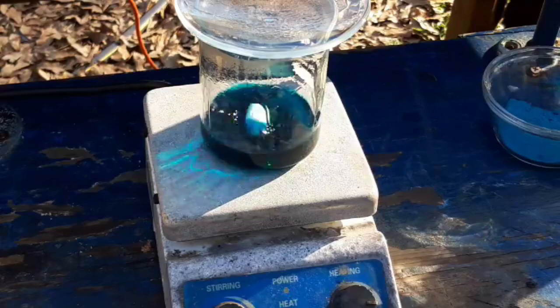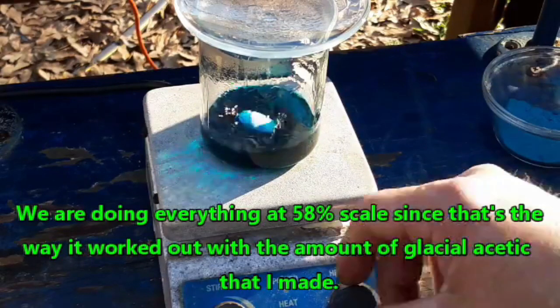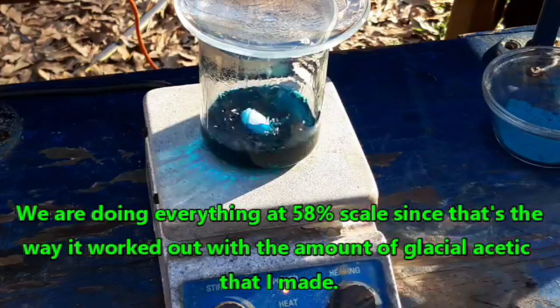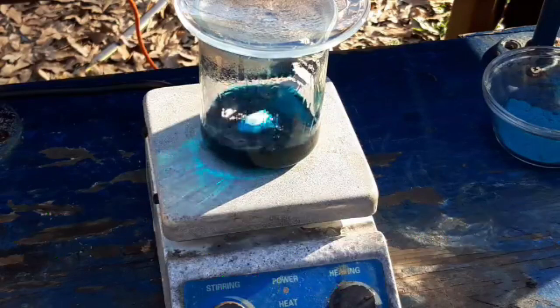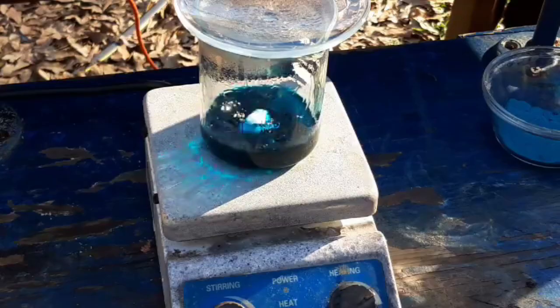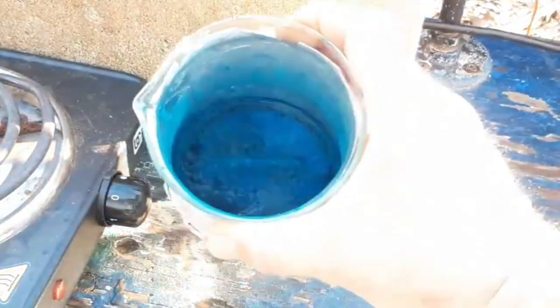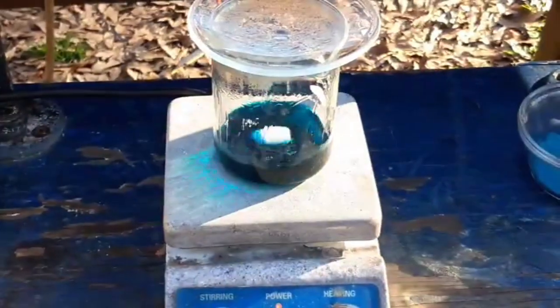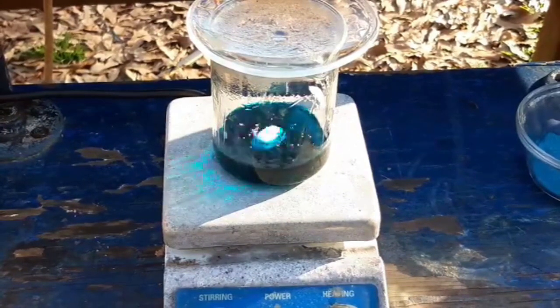The way that this prep starts out, we have to have a hot solution of copper acetate and glacial acetic acid. This was interesting because I had to make copper acetate from copper carbonate. You can see this is where I'm working on the second crop of crystals here. It's very nice, very pretty. But I used all of my glacial acetic acid making the copper acetate.